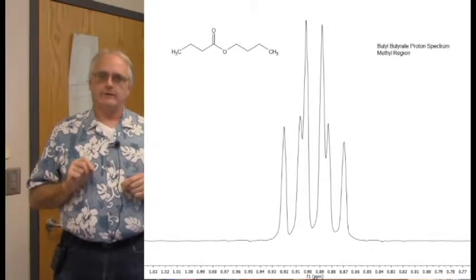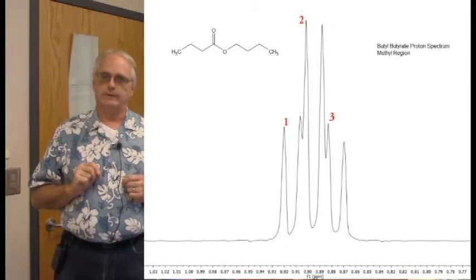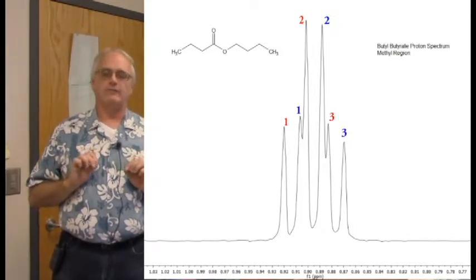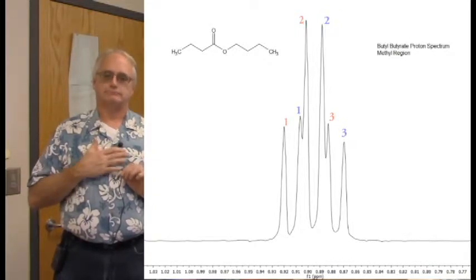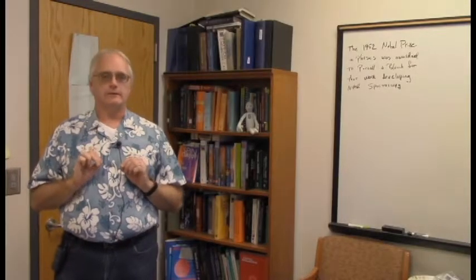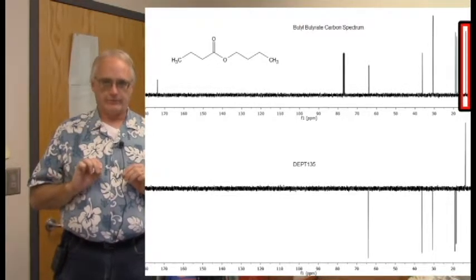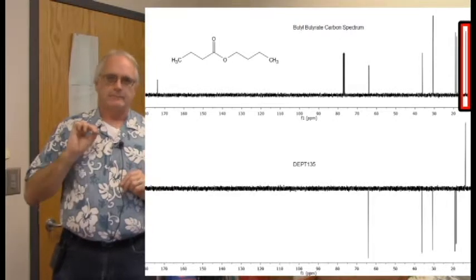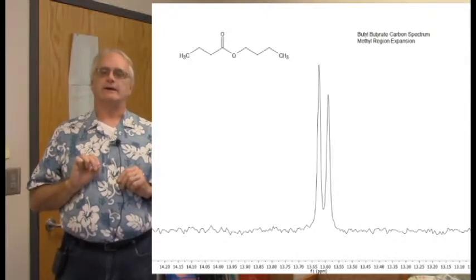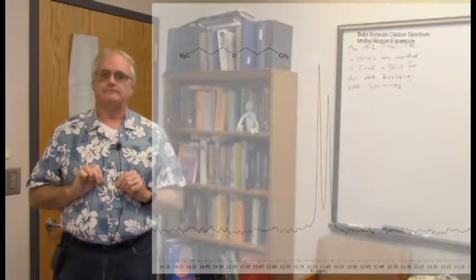If you look at it carefully, there's one triplet here, 1, 2, 3, and the classic 1 to 2 to 1 ratio. Here's the other, 1, 2, 3, classic 1 to 2 to 1 ratio. It's actually a lovely, lovely pattern. Just makes me feel so good to think about. And sure enough, you also see it in the carbon spectra. We focus in on the methyl groups. The DEPT 135 told us these are methyls. It looks like one peak, but if you zoom in very carefully, oh, there it is. They are 2 peaks. Again, almost perfectly overlapped, but not quite. We can see the difference.